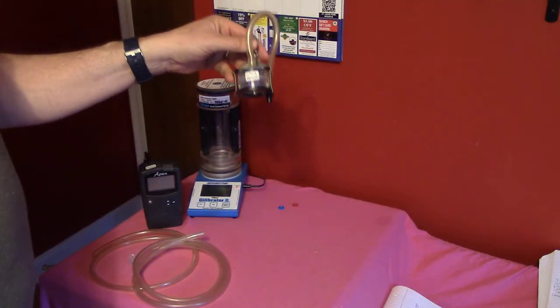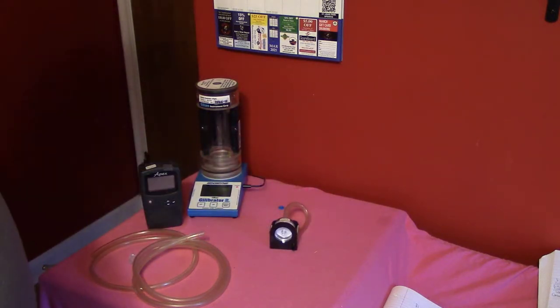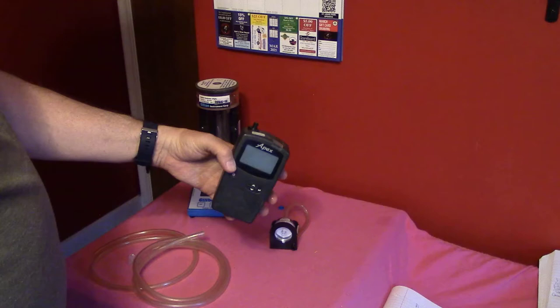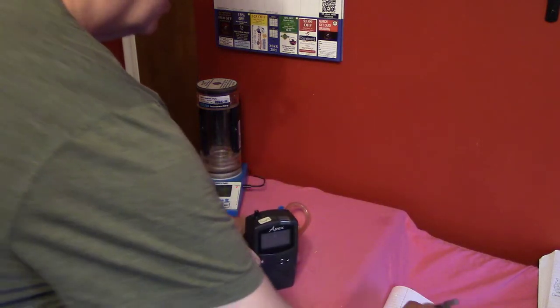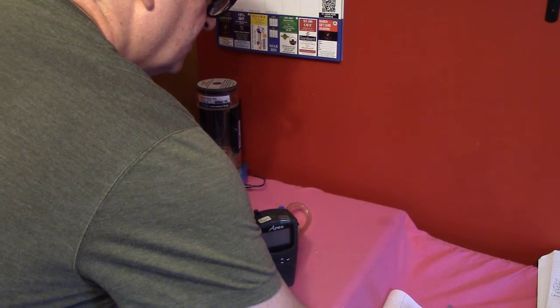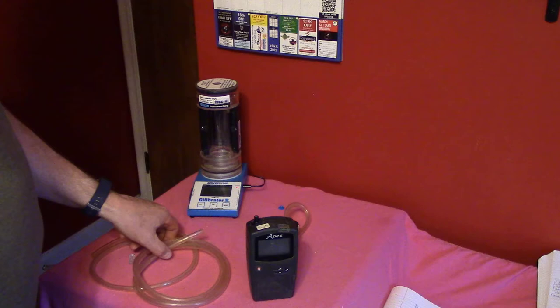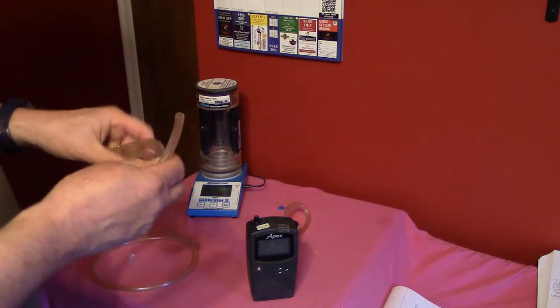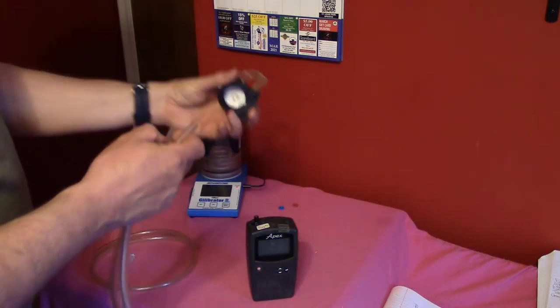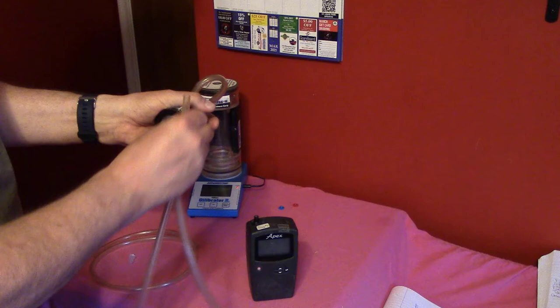We're going to connect the tubing through this connector to the outlet of the cassette, and so this is ready for calibration. Next we'll look at the pump. We're going to record the pump number — we've labeled this as pump number five — and I'm going to record that in my lab notebook. Then I want to connect the pump to the outlet of the filter holder with this tubing, making sure it slides on so there's no air leakage.